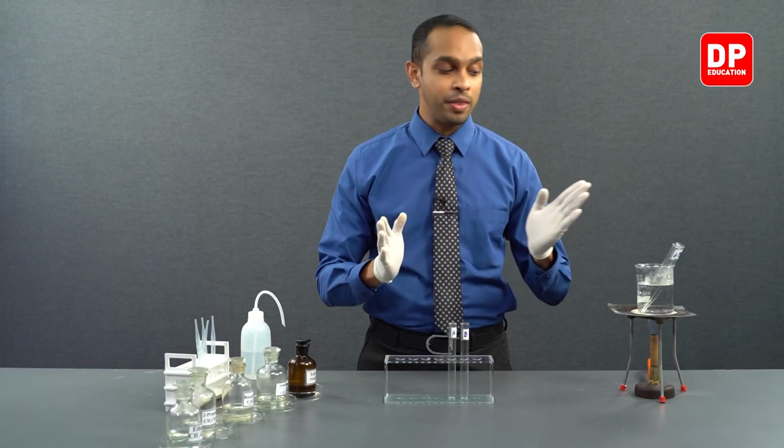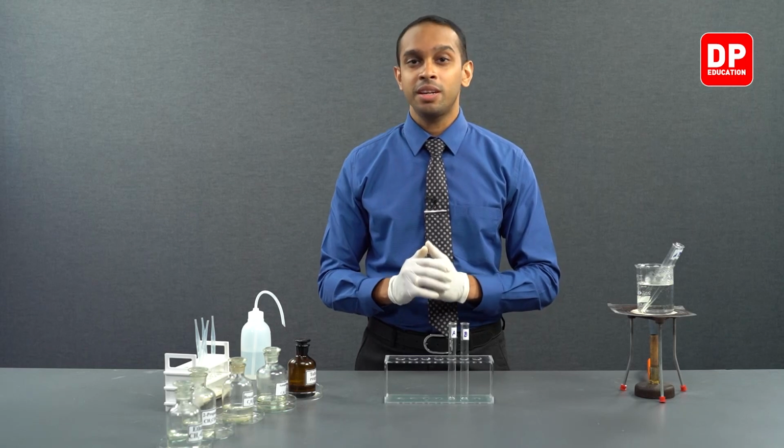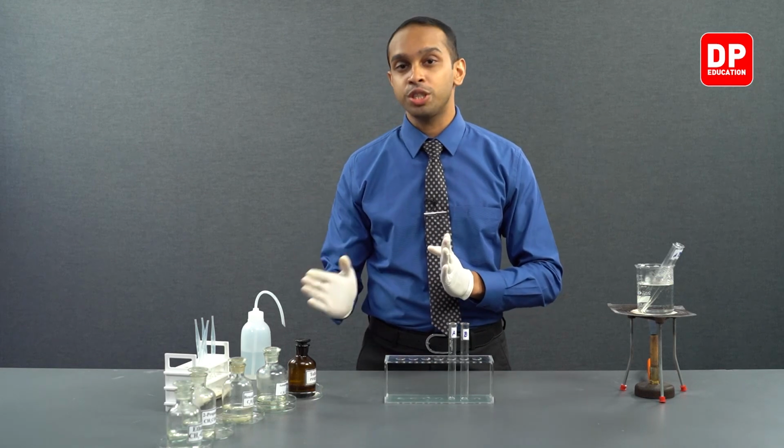We know in the test tube B, we are having a ketone. Ketones do not answer to the Tollens reagent, so you will not see a silver mirror being formed with ketones. However, test tube A should end up forming a silver mirror as we have an aldehyde in the test tube along with our Tollens reagent.